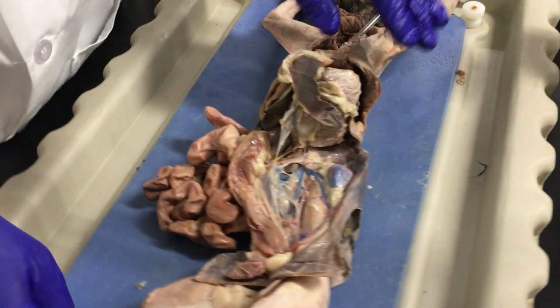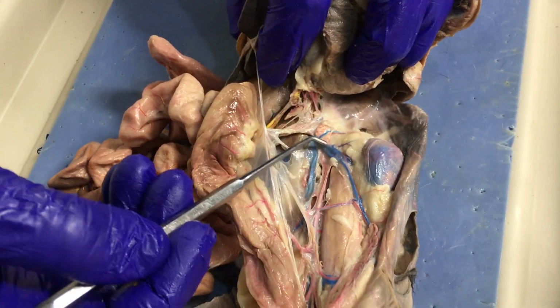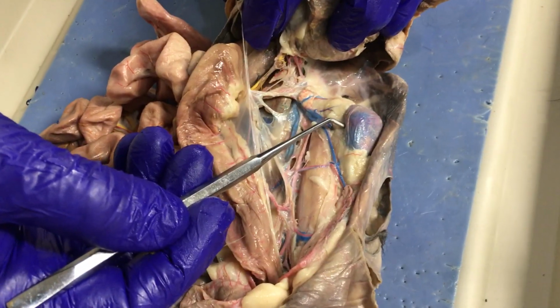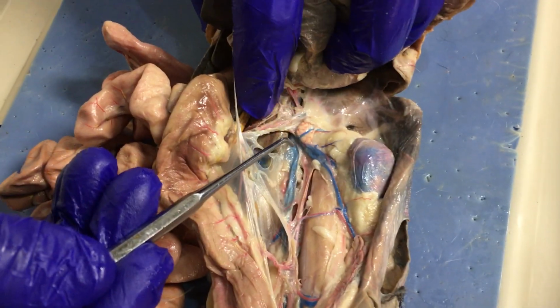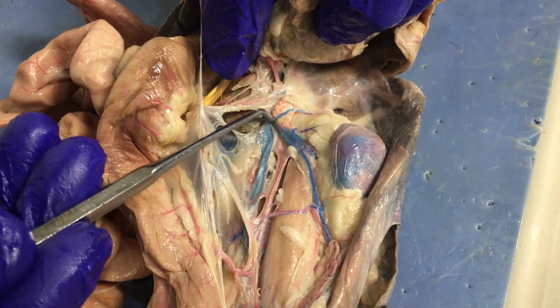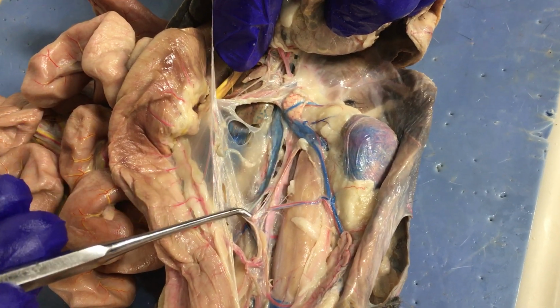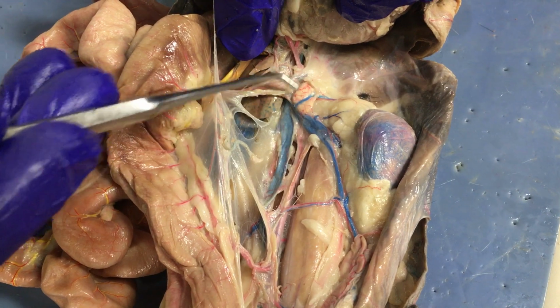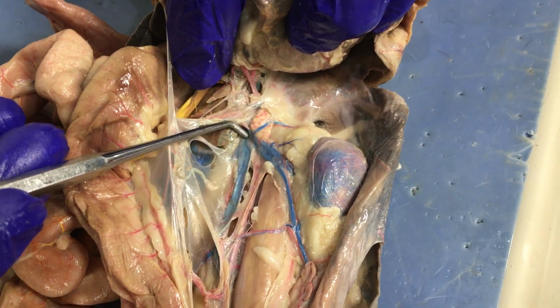Okay. So, start with the veins, right? Here's the renal vein going over the kidney. Abdominal structure, yeah? Abdominal blood vessels. Starting with the retroperitoneal veins. There's the renal vein, right? And it's coming out of the inferior vena cava, which is this long one here. There's the adrenal gland, and the little suprarenal vein crosses it. Okay?